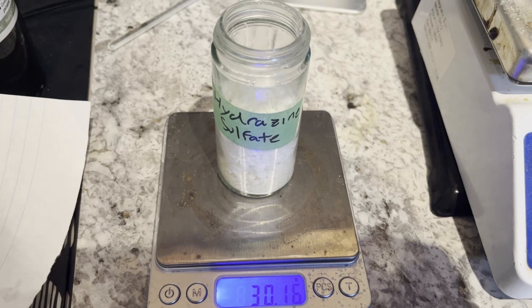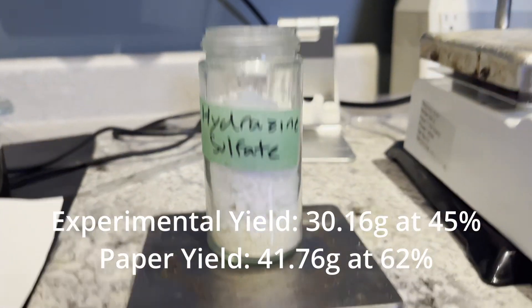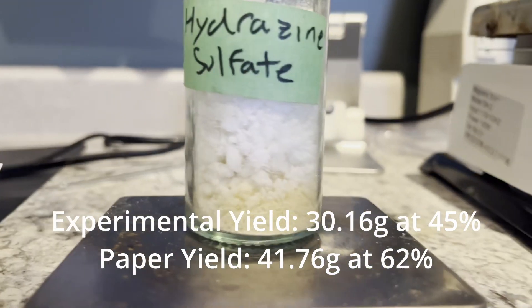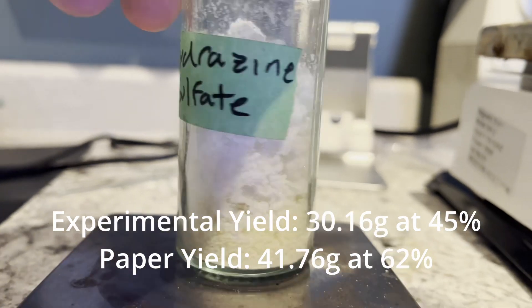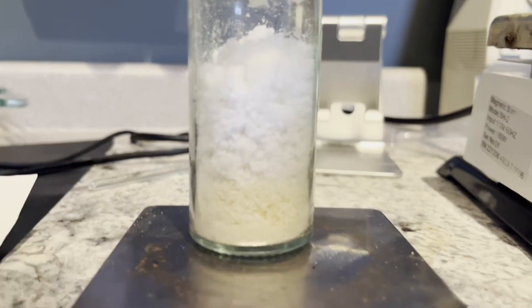So because I follow the paper pretty closely and I only got 30 grams, I feel like my bleach solution is under-concentrated to that which I believe. This is due to it being old and I haven't bought a new one yet.